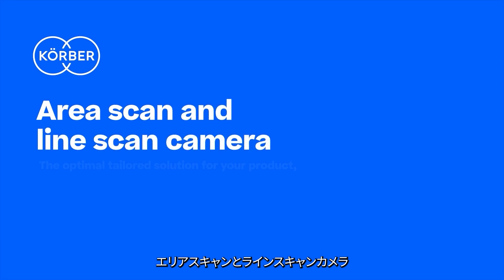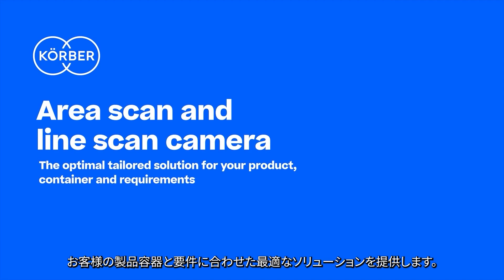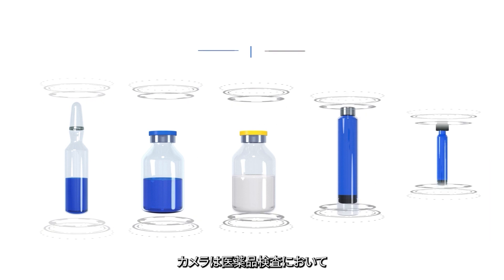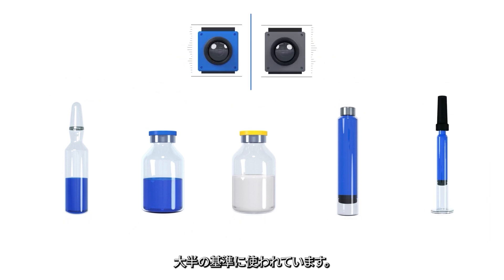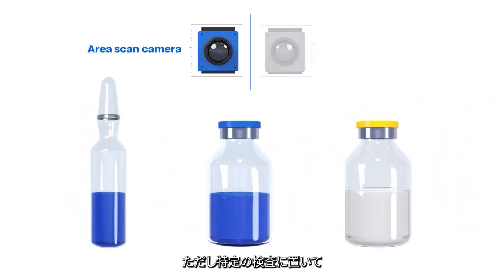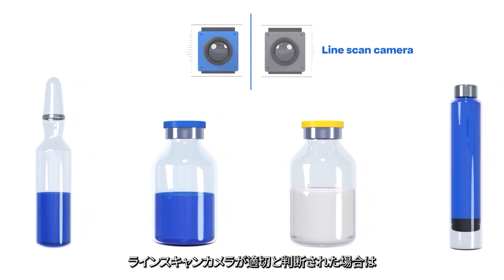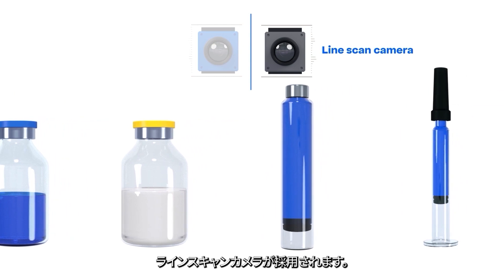Area scan and line scan cameras: the optimal tailored solution for your product, container and requirements. Cameras are used for the vast majority of criteria in the inspection of pharmaceutical products. In most cases we employ area scan cameras. If our evaluation of a specific product being inspected concludes that a line scan camera is more appropriate, that type of camera will be used for the inspection.